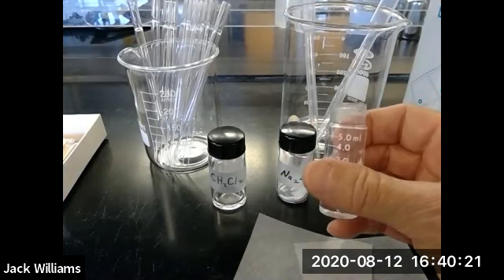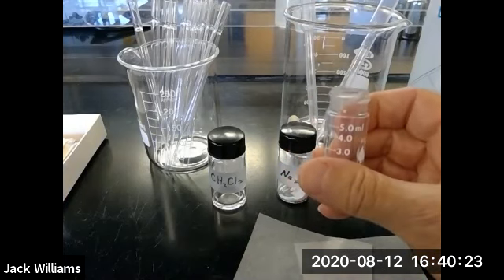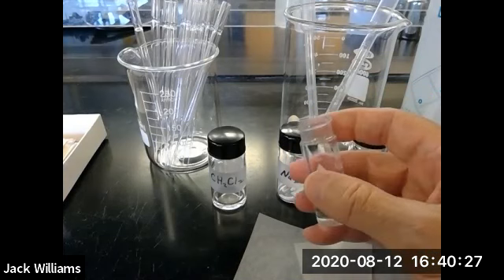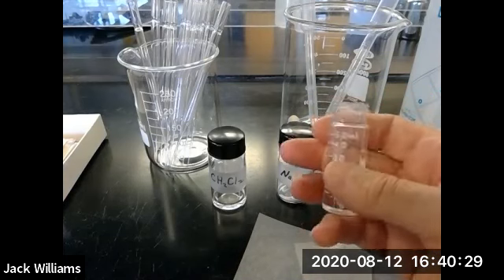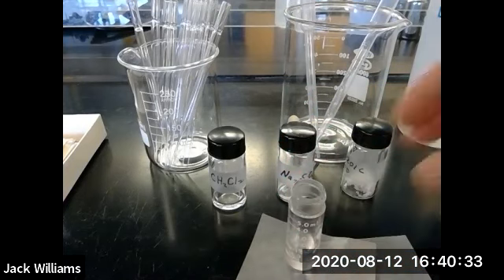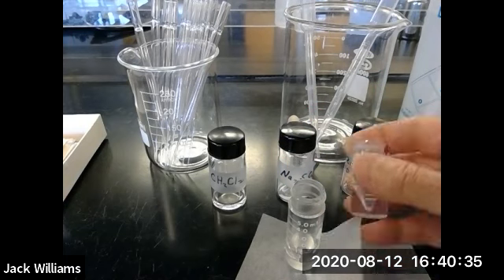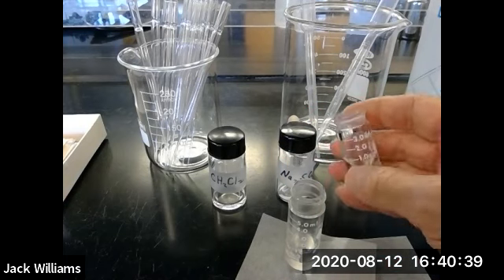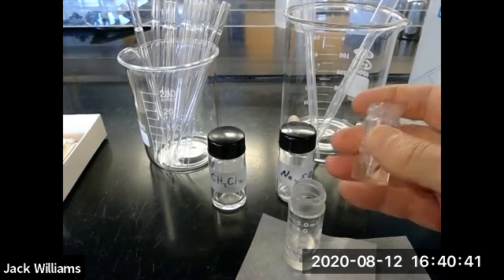So only the student will use that drawer. So no one else, which is kind of nice. So that's your own personal laboratory desk drawer. So it's a 5 ml conical vial. And the other one that we're going to use is a 3 ml. Looks something like this. And sometimes the marking wears off. So this is a 3 ml.